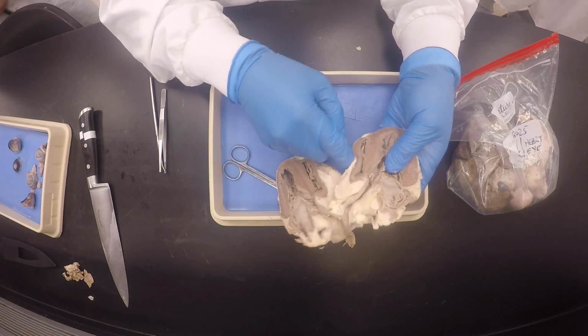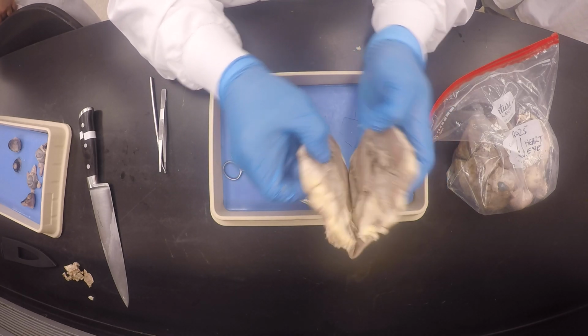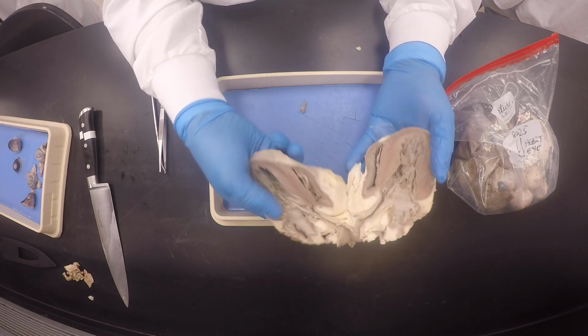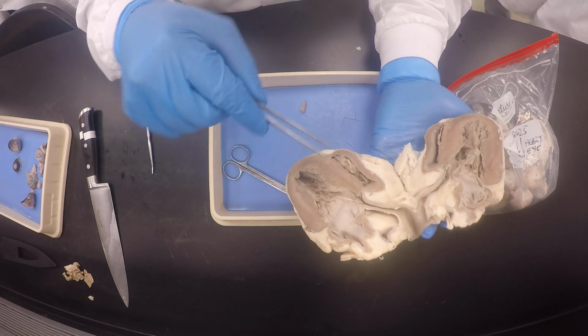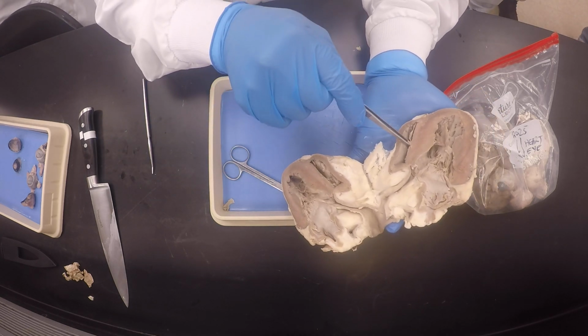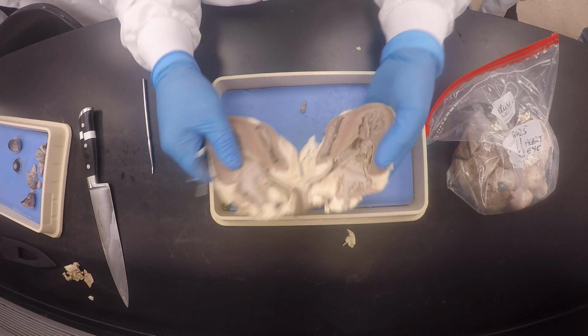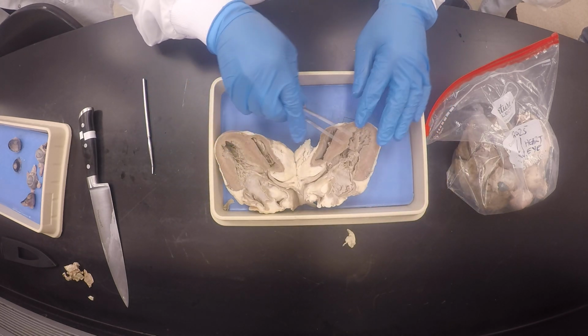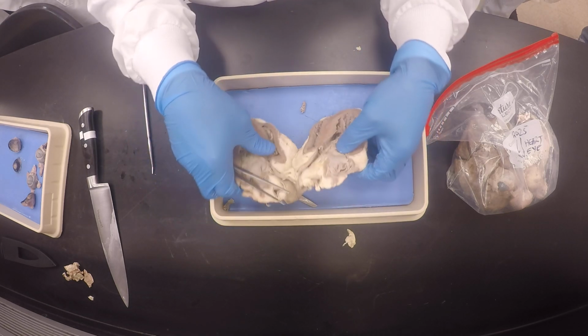This one, you see, because of this indentation, there's my moderator band, which is attached like that. So it kind of got cut, but I will show you. You see, there's my moderator band, which is here. So it's one of those things that could happen, and I will contrast this, but at least I can see my valves, right?